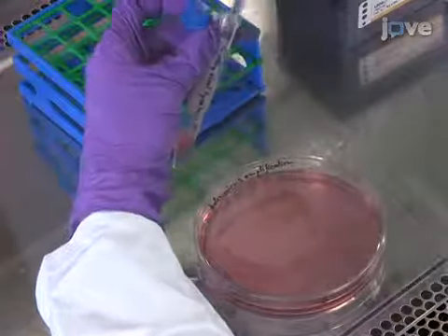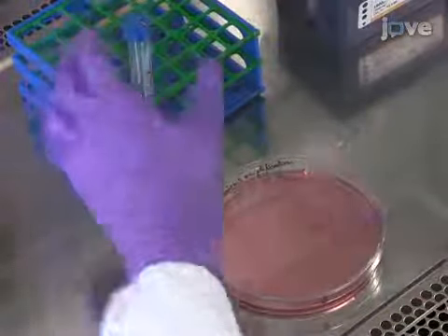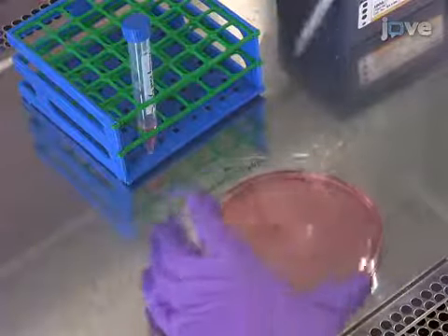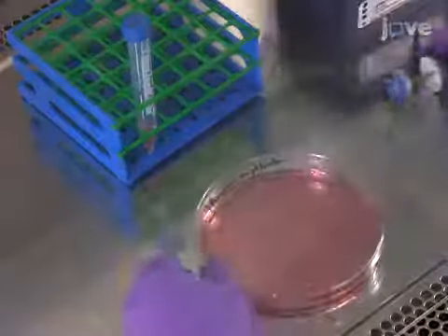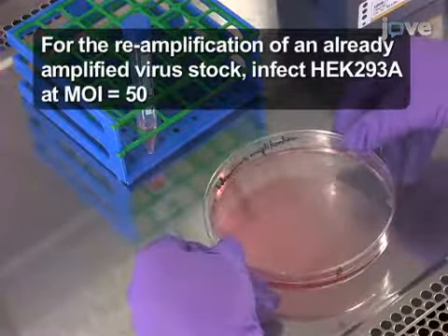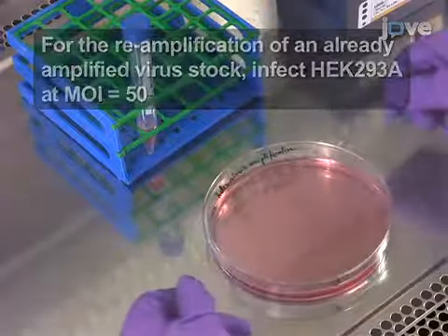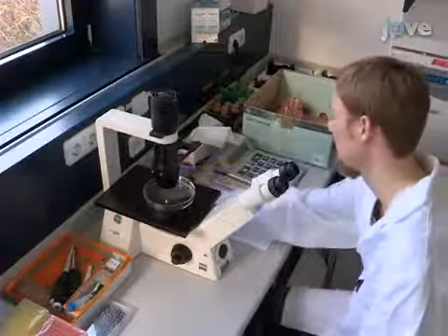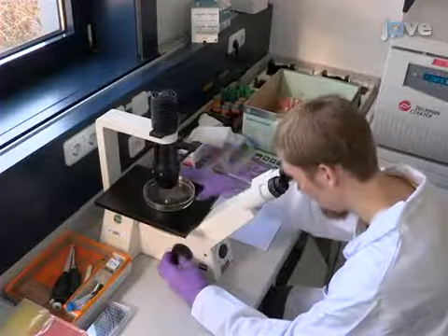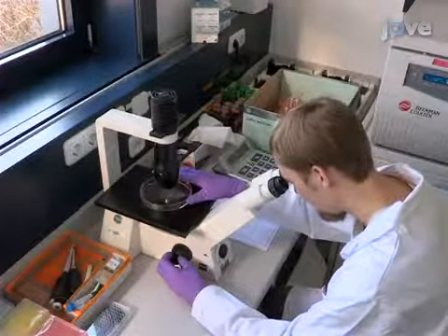To amplify the primary virus lysate, infect HEK293A cells grown to 90% confluence on 15 cm tissue culture dishes with half of the primary virus lysate and incubate for at least 36 hours. After 36 hours, check for infection by fluorescence microscopy. Nearly all cells should be infected.